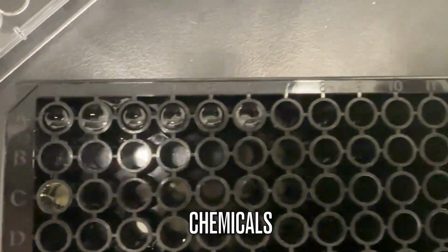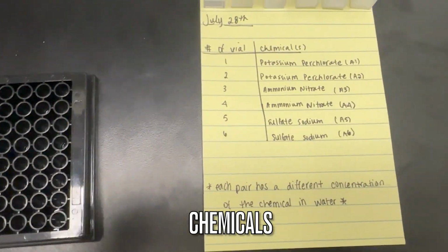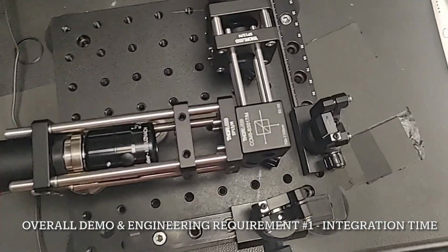And as you can see, A1 through A6 are the chemicals that we are testing with. But for this demo, we will only be using 2 chemicals. This is our spectrometer. We've made a couple of adjustments since last time.